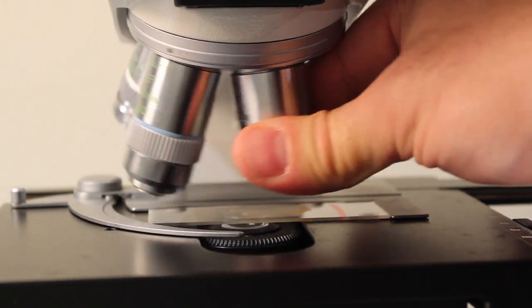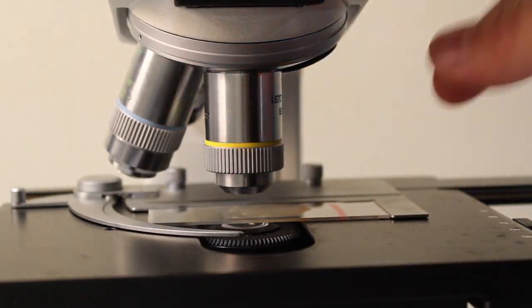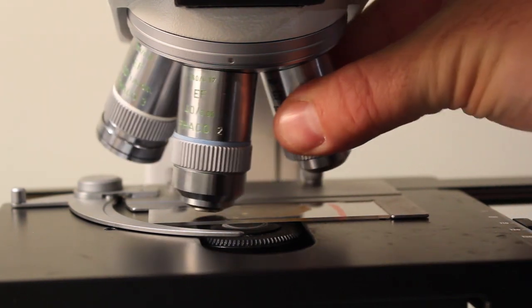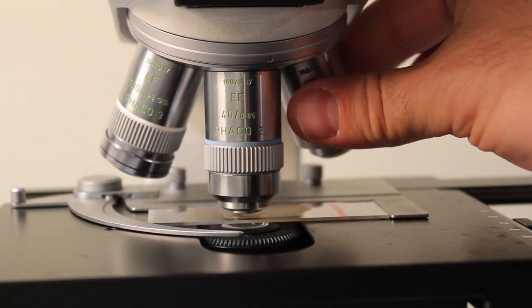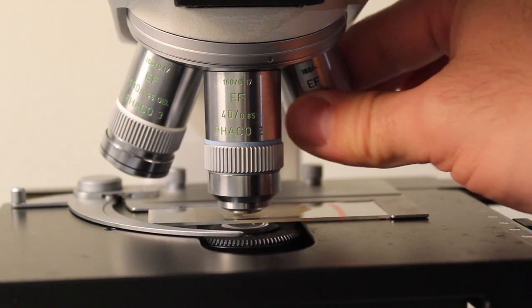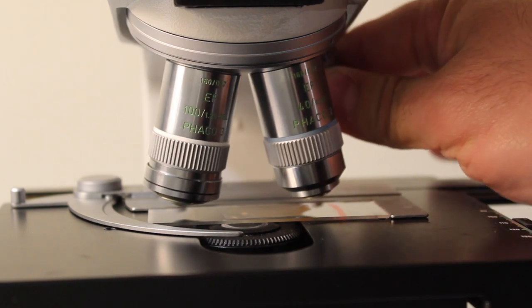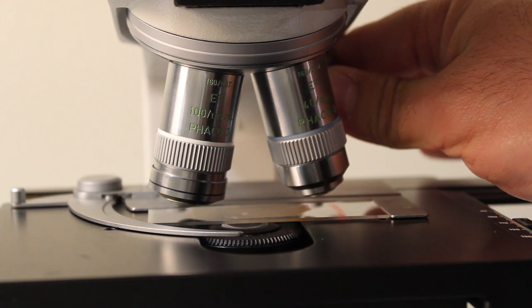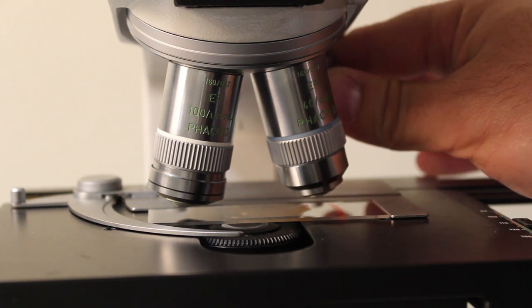Ideally, you should have your microscope configured so that you can rotate in the same direction from your lowest magnification lens to your medium magnification lens or medium magnification lenses and have your oil immersion lenses or your highest magnification lenses at the end of that rotation curve.